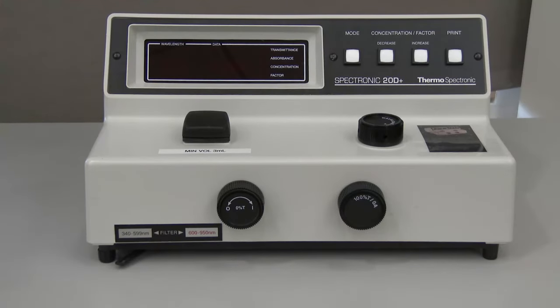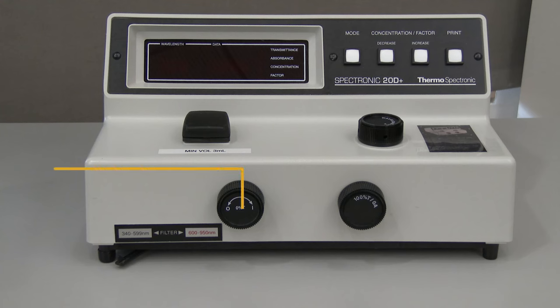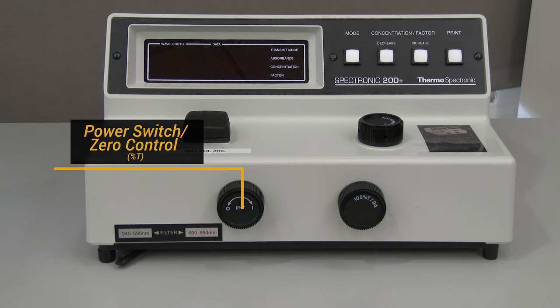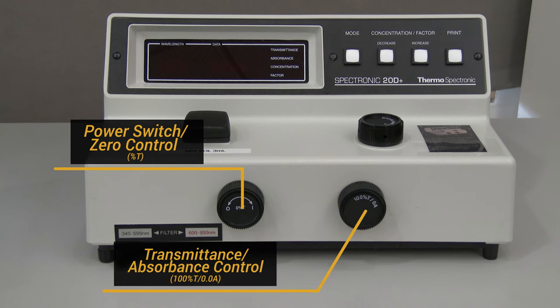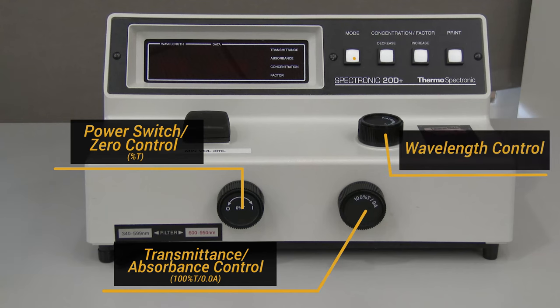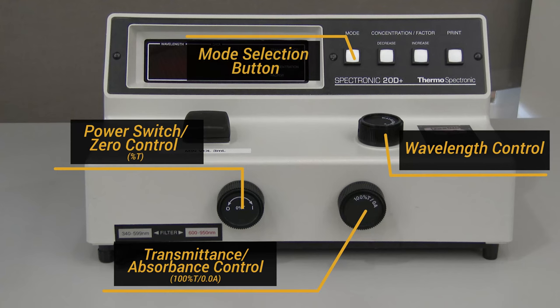The main controls for routine operation of this spectrophotometer include the power switch zero control, percentage T, the transmittance absorbance control, 100% T, 0.0 A, the wavelength control, and the mode selection button.